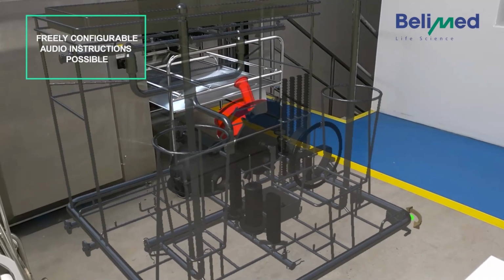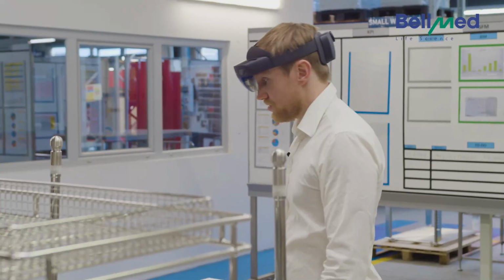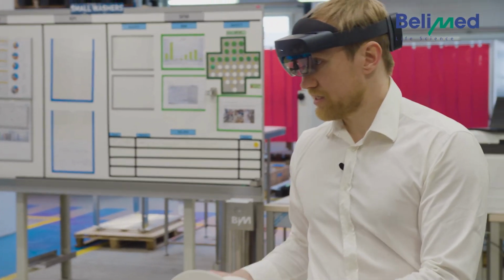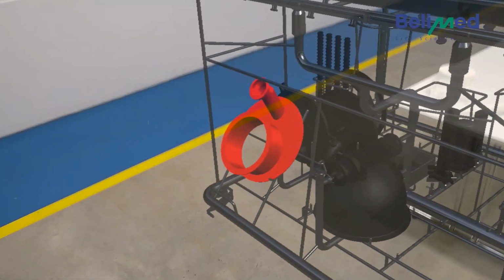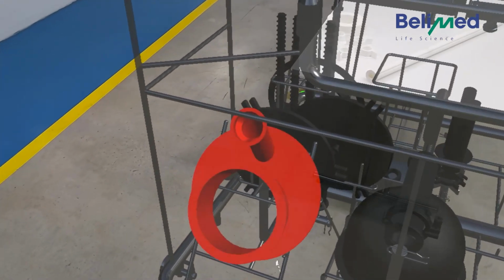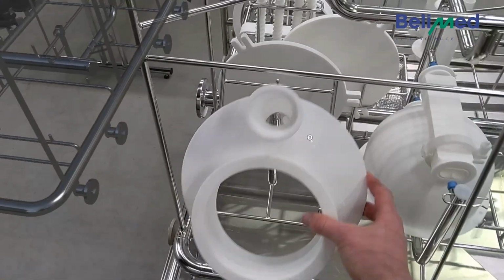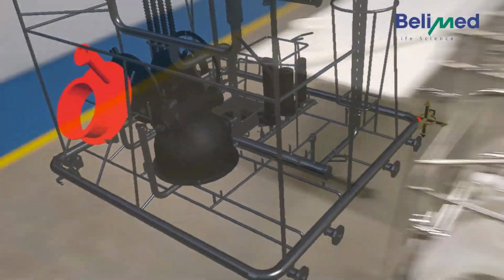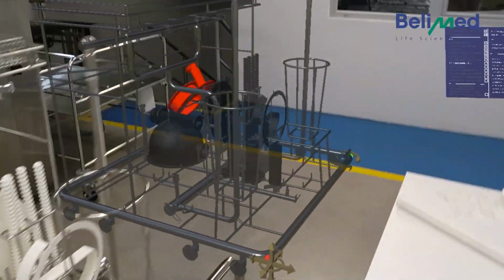Ensure the correct orientation of the wash item as shown in the visualization. So the next part is a critical part because the orientation is again really important. So you can also add that by audio or visual things. So you can see it needs to be positioned like this. So we hang it in exactly as shown here on the virtual model. Check.